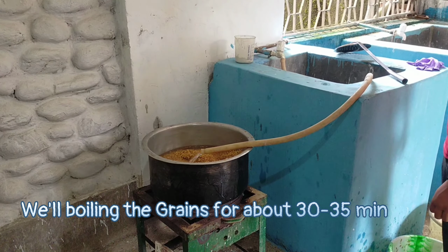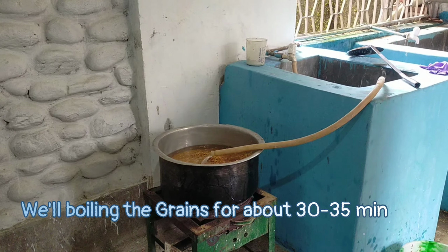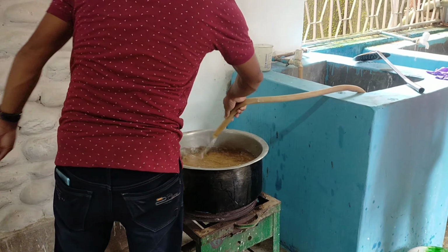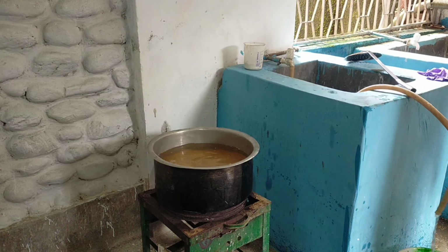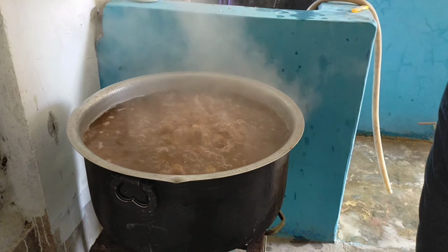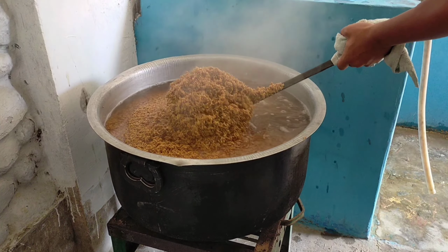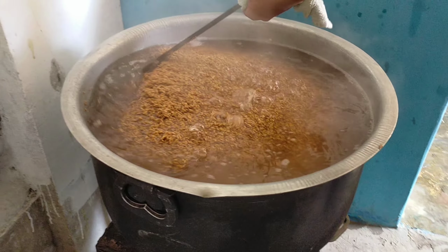Next step is boiling the grain partially. It should not be cooked fully. It should always be half cooked. And the most important thing is the grain should not burst. Now we're gonna boil this grain for about 30 to 35 minutes. Bring it to boil and cook at medium heat. Keep stirring the grains and make sure that the grain doesn't stick at the bottom, as we do not want our grain to be burned.